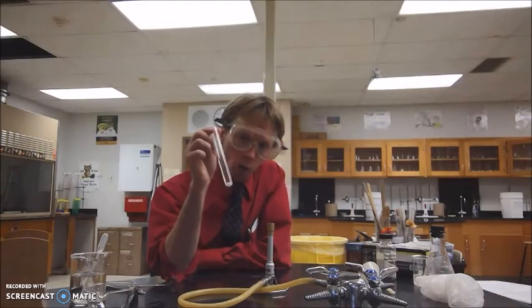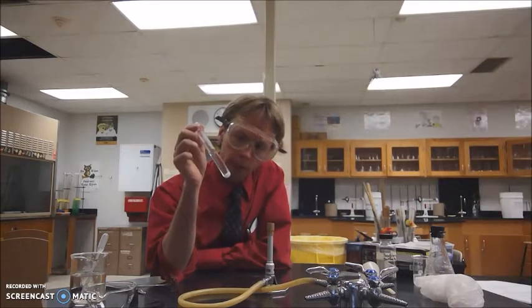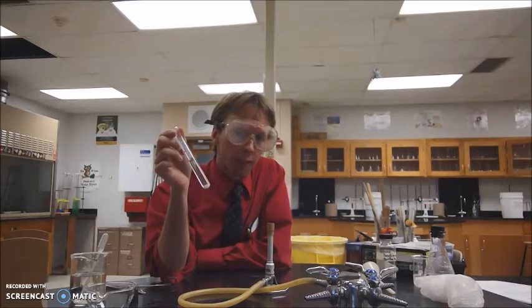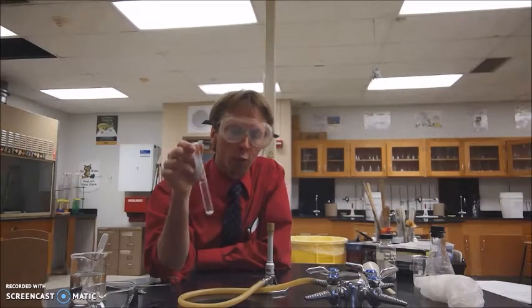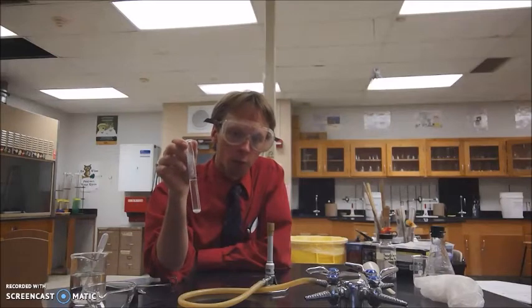We have a mixture of sodium sulfate and water, but as you can see, there's a small amount of white powder sitting at the bottom and not dissolved. In chemistry, there's two ways we can make things dissolve. We can either shake it or stir it, but that's not always the best option. What you can also do is raise the temperature of the mixture, and that will make the powder dissolve much more quickly in the water.